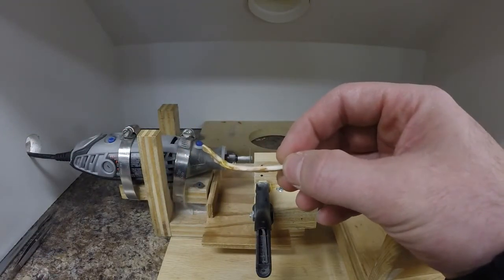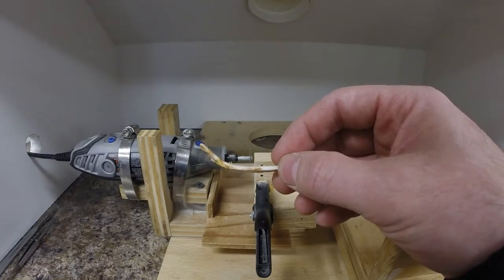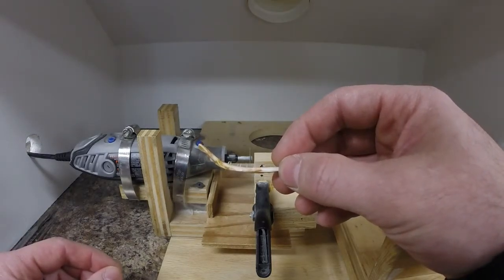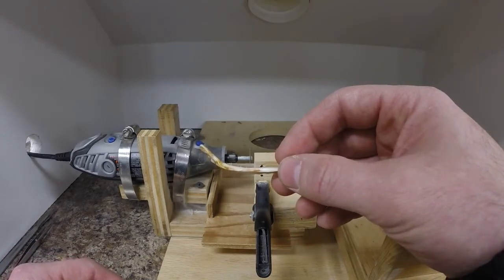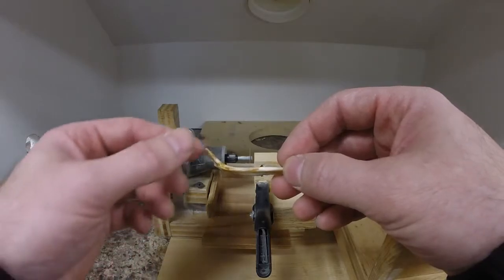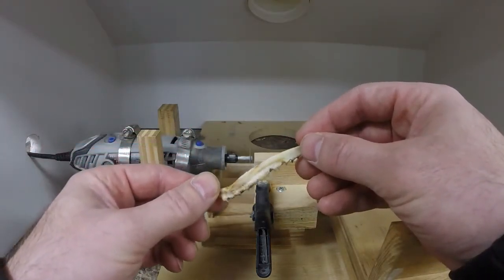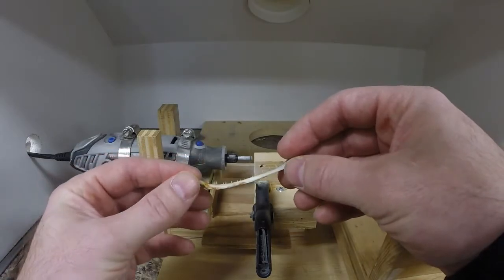It's not a deal breaker. When you age these sections, you can just hold them at a little bit of an angle with forceps and then be able to look straight down through them. But it would be a little more ideal if I had a setup where it could hold at whatever angle I want, so at some point in the future I need to work on that.